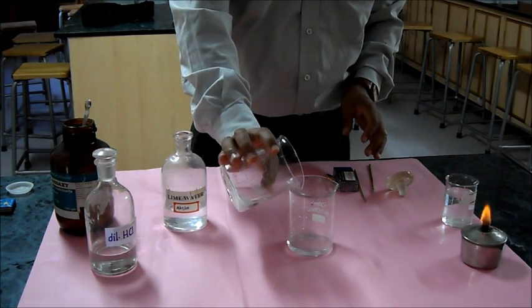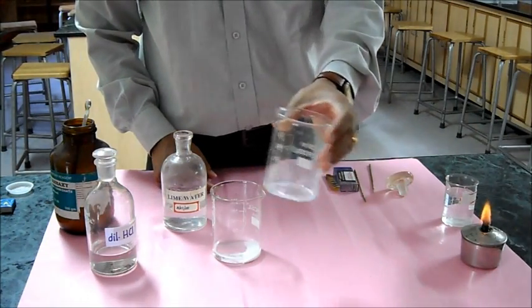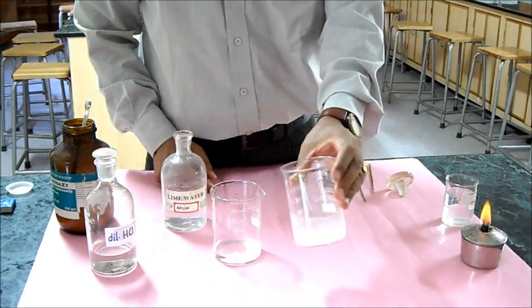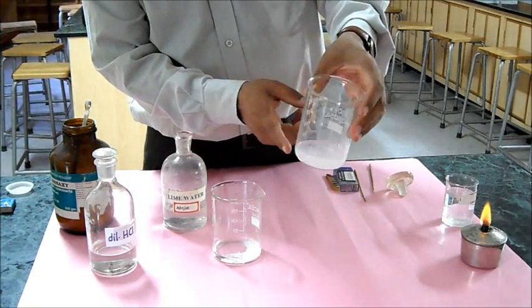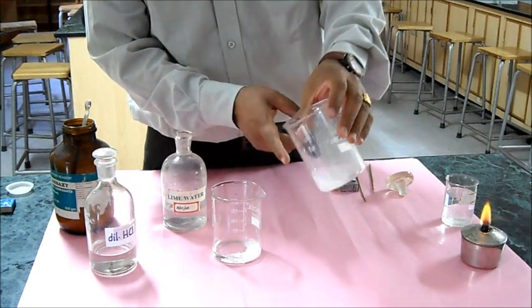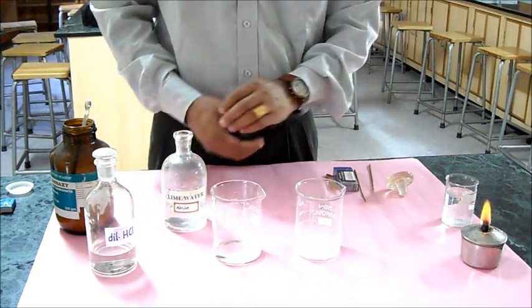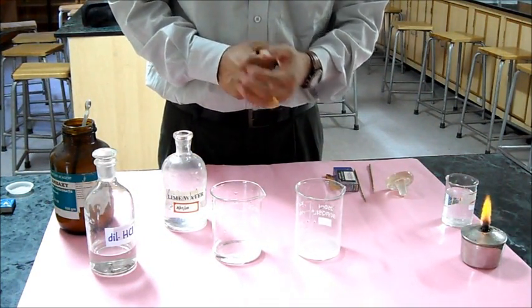When I pour the gas into the lime water, the gas settles down. If I shake it, the gas is absorbed by the lime water and the lime water turns milky, showing that the gas is nothing but carbon dioxide.